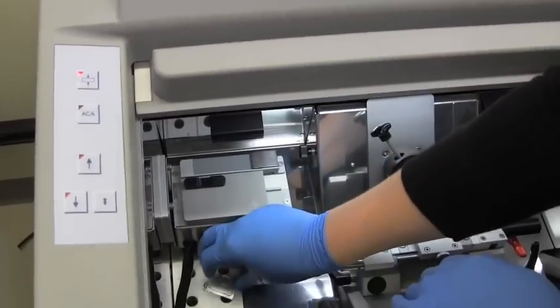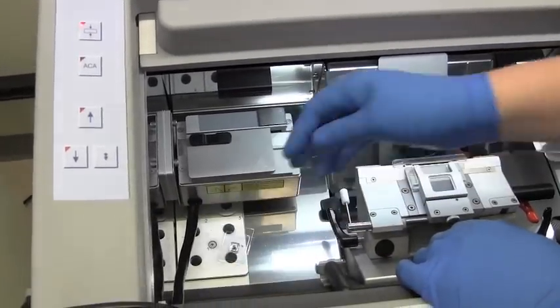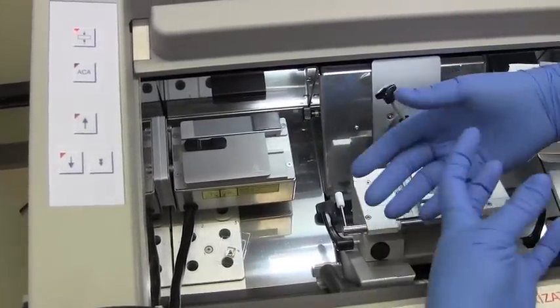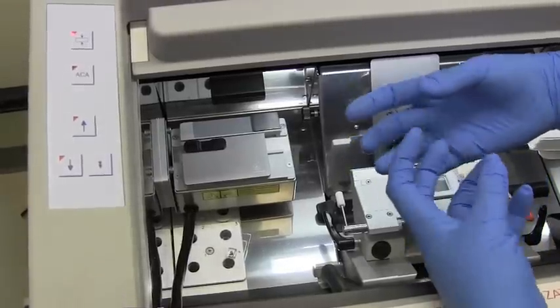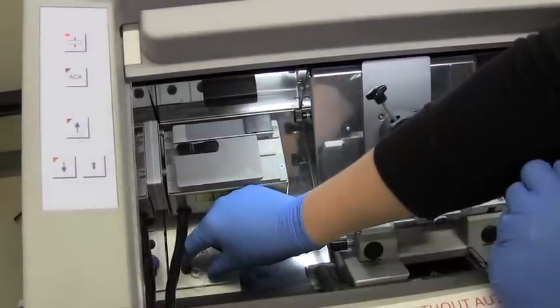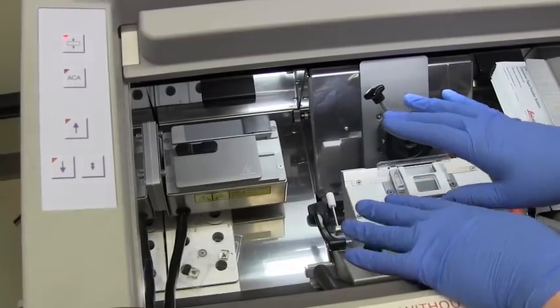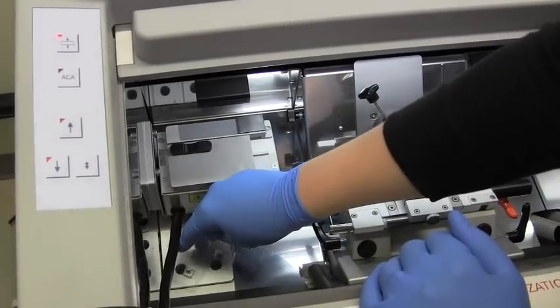When we put our samples onto that block, the polyethylene glycol and sugars that are in the matrix will freeze solid within a couple of minutes. I give it about 15 minutes so that they're really as solid as possible.